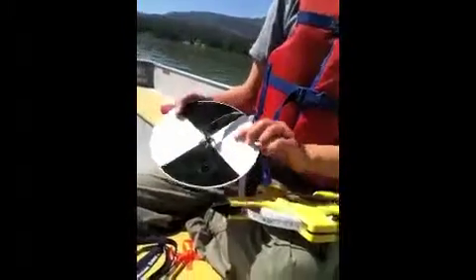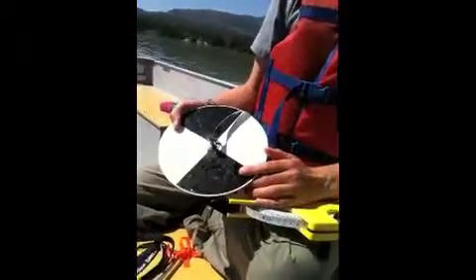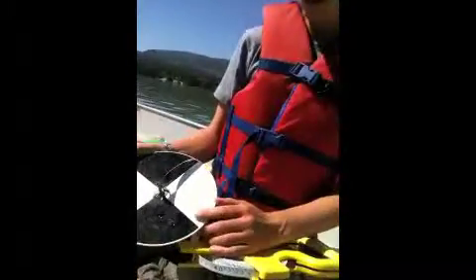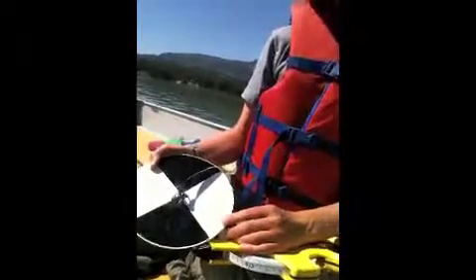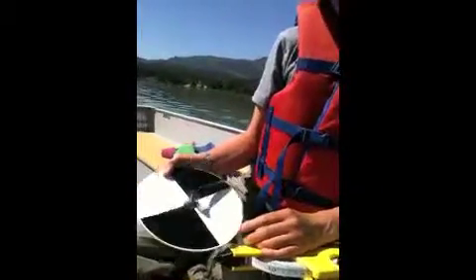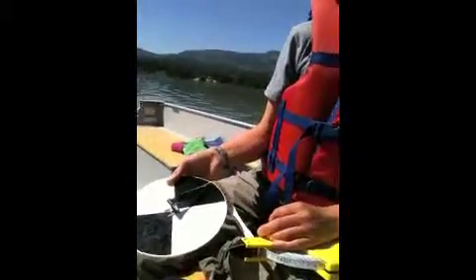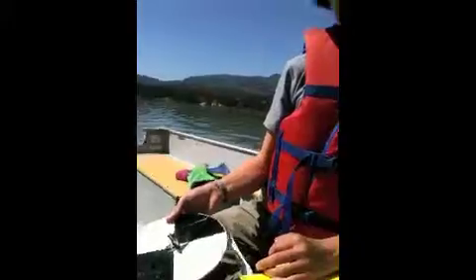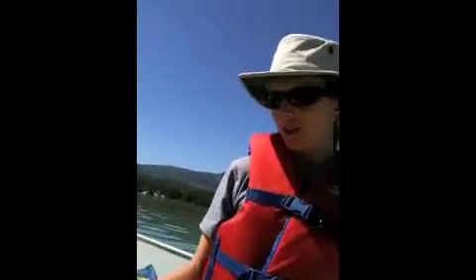This little disk right here helps us measure the depth, and this neat black and white pattern helps us see the disk in the water. So this measures water clarity. When we can no longer see the disk — either color — we know that's how much light is penetrating into the water.